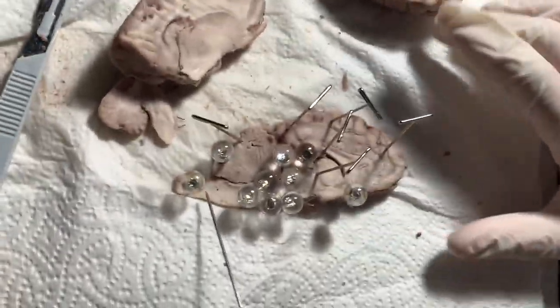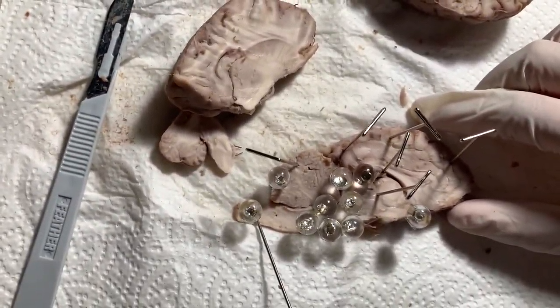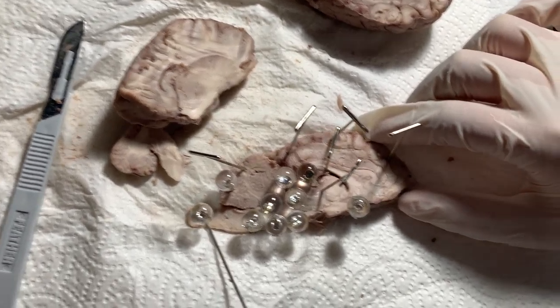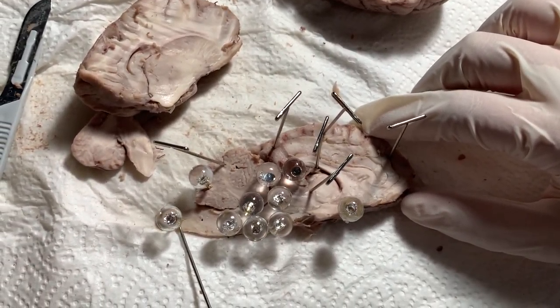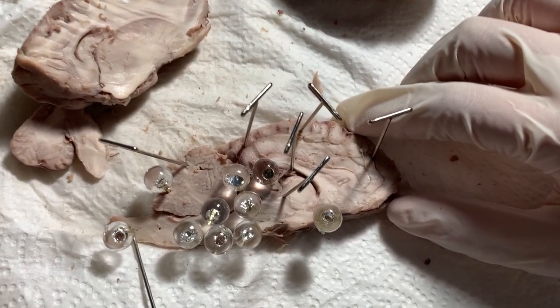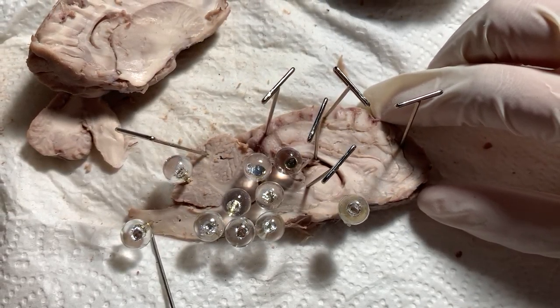First we will be talking about the spinal cord, which is located right here. The spinal cord's function is for electrochemical communication, mainly used for sending signals throughout the body through the brain.